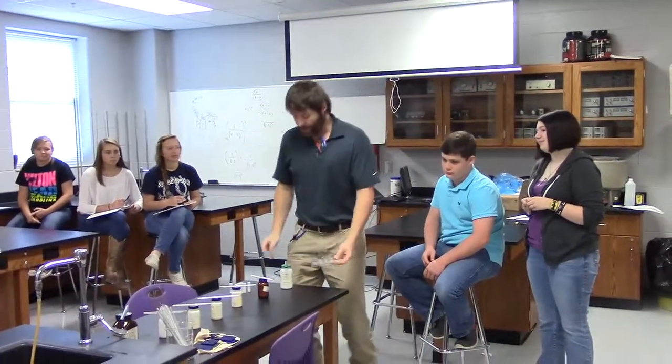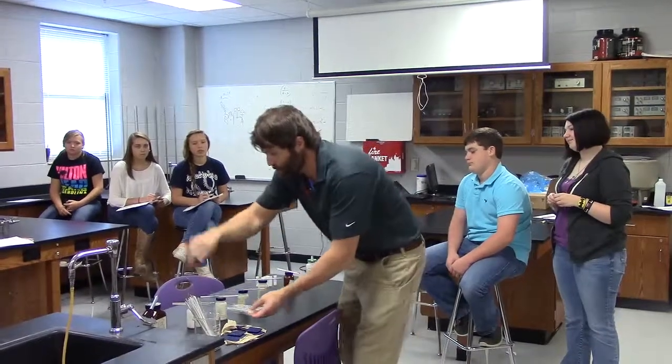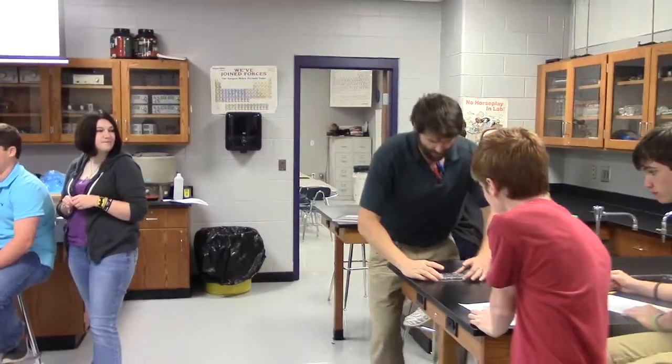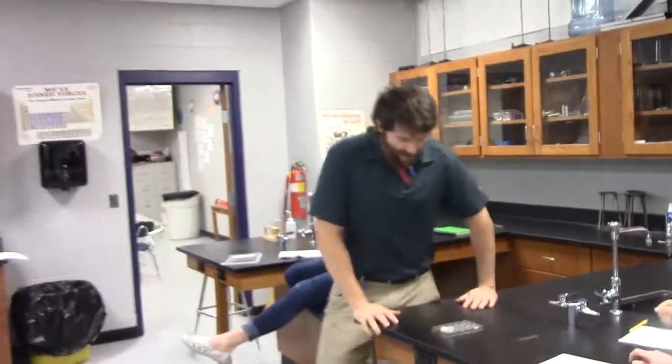It's gone. So, number 1 tomorrow is you need to come through and do what? Get one of every one of these. Make sure you know where it goes. And grab one of the unknowns. So I'll come back over to my table. Get ready to do my lab. Alright, I got that. Now, what else do I need?